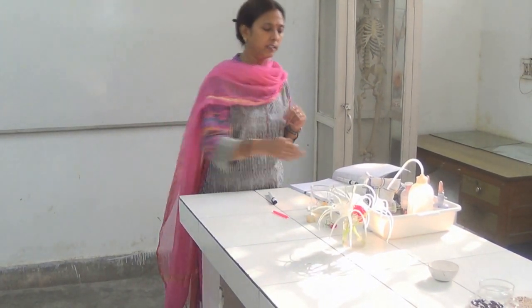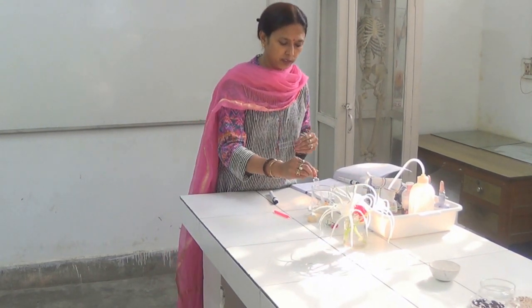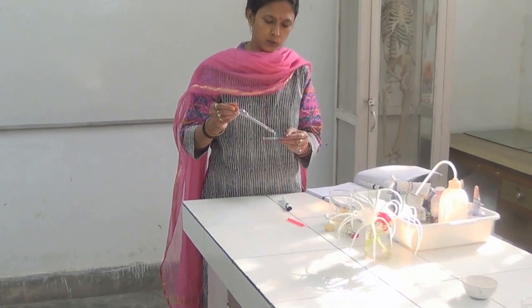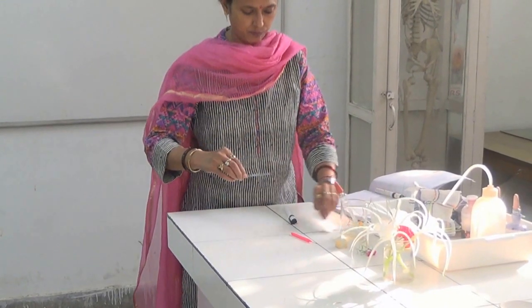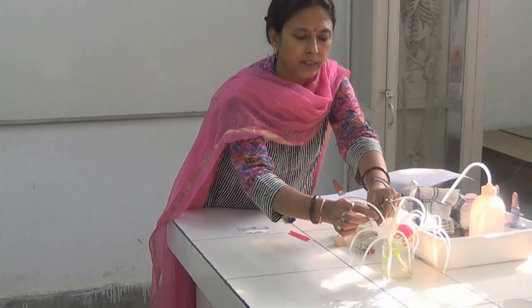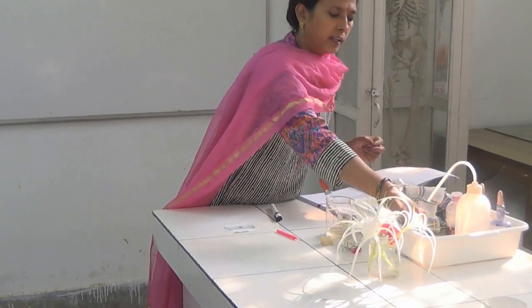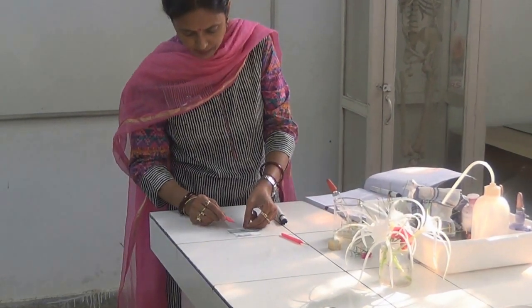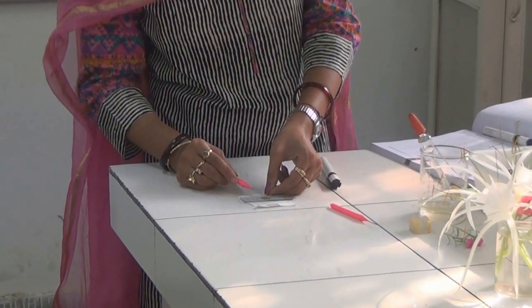Now, we will take our cavity slide. With the help of a dropper, we will put two to three drops of the nutrient medium in the cavity. We will then take a pollen-bearing anther and, slowly with the help of a needle, we will dust a few pollens into the nutrient medium.